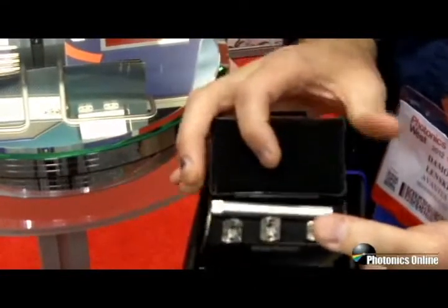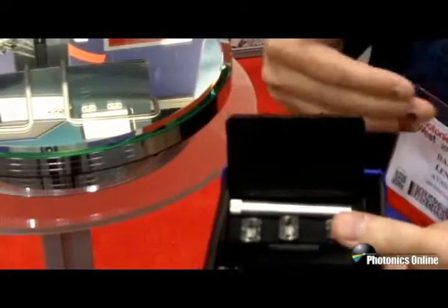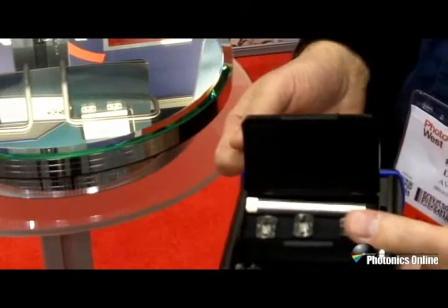This enables you to use a smaller slit for high resolution and a larger slit for high throughput applications. This can all be done without wavelength calibration at your location, making it very easy to change the slit and continue on with your measurements.